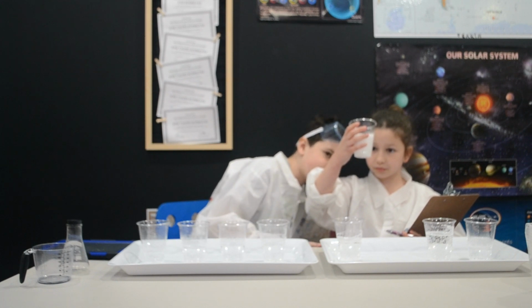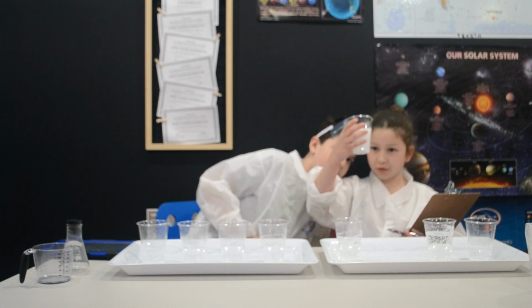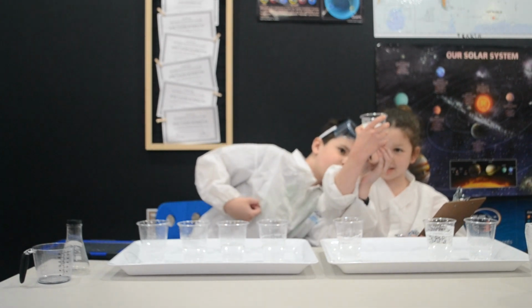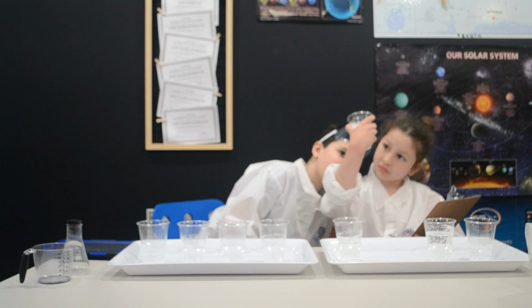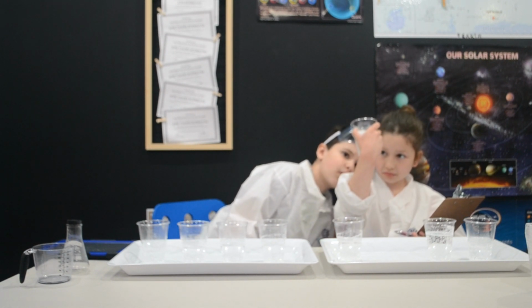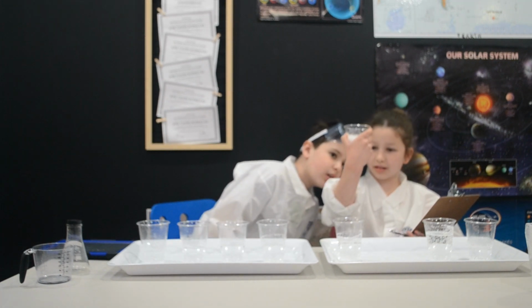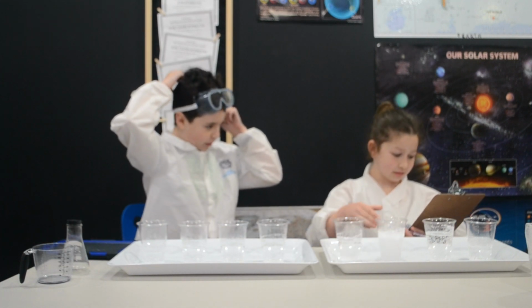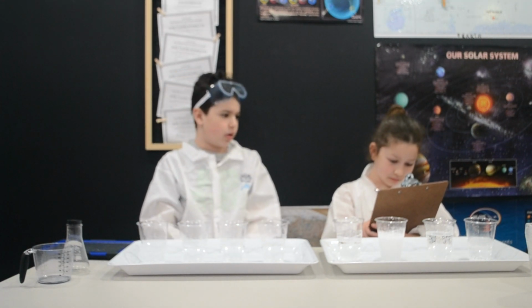For some reason, it has small times where it's pressing on the floor. It's moving sideways. Stop moving. Wait. I think it's done. It's done. 58.95. It's weird how much it fluctuates. We must have done something wrong.